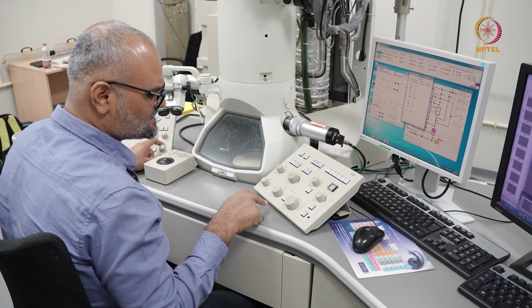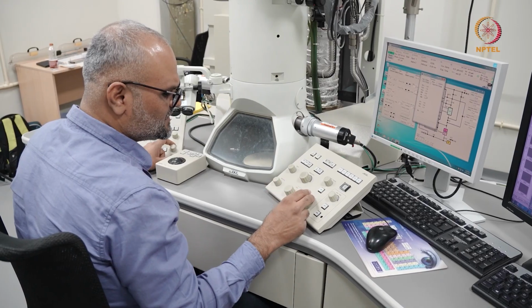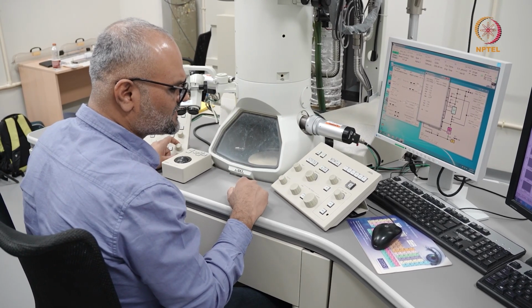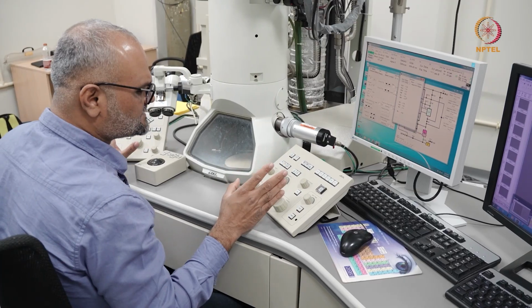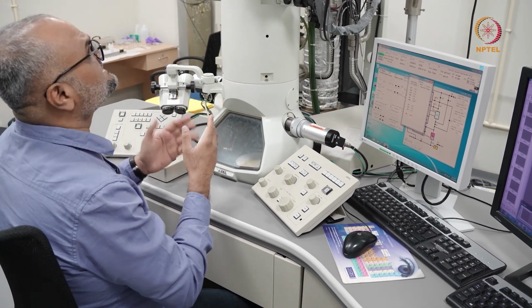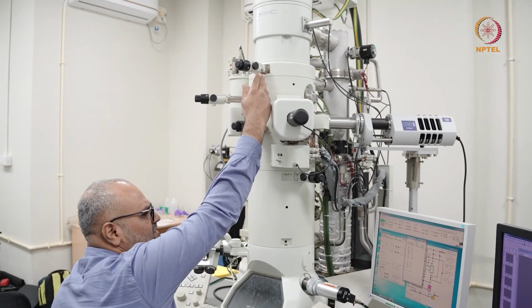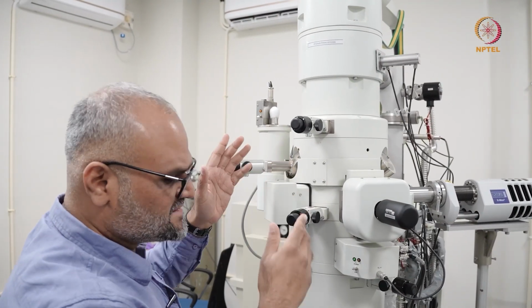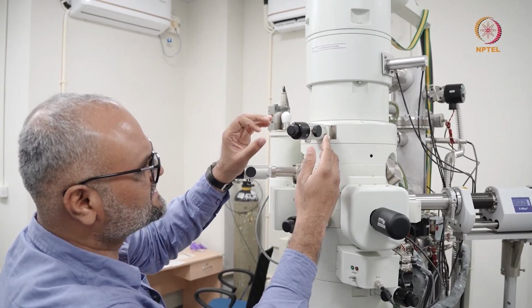If I press coarse here, or if I remove coarse here, you can do fine adjustment or coarse adjustment of the focus. So this is the basic layout of your console. We will now start with switching on the electron beam, and we'll do basic alignment by adjusting the objective aperture here. Once I start imaging and I switch on the beam, I have to turn off the light, so it is not possible to show this.